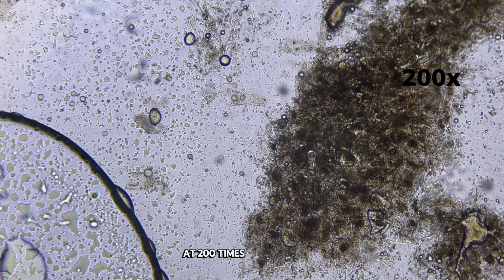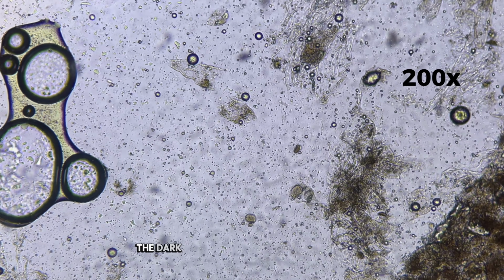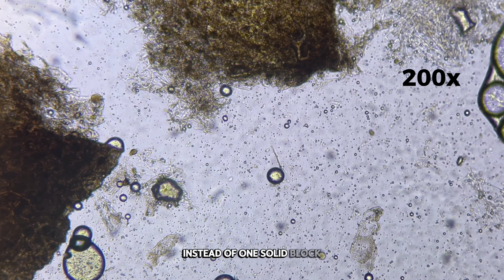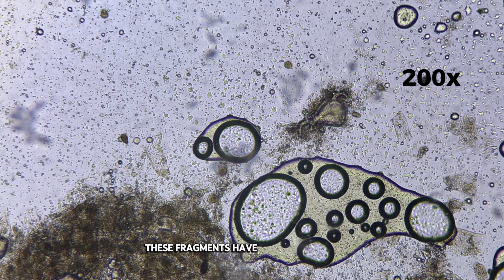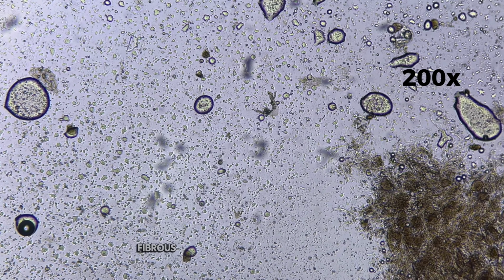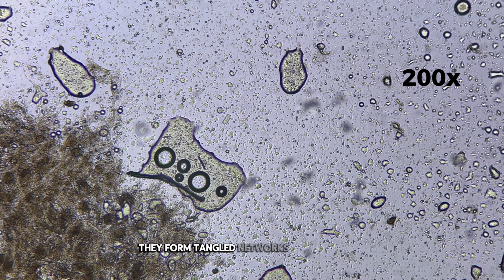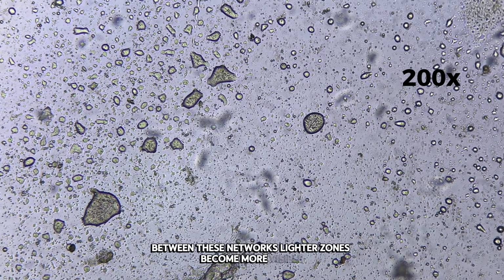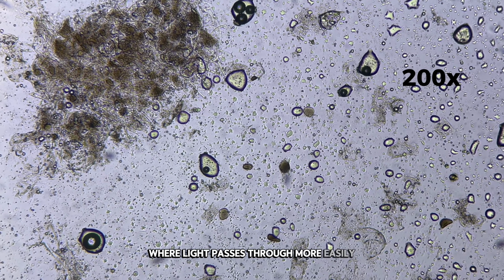At 200 times magnification, the internal organization of the olive becomes clearer. The dark masses begin to break into smaller structural regions. Instead of one solid block, the olive reveals layered fragments pressed together. These fragments have uneven boundaries that twist and curve naturally. Thin fibrous elements start to appear along the edges of the darker areas. They form tangled networks that connect one region to another. Between these networks, lighter zones become more visible. These areas suggest oil-rich regions where light passes through more easily.